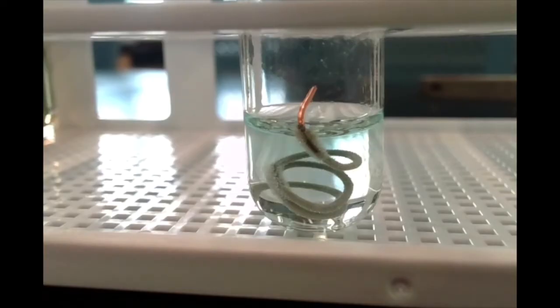And you can see the silver thickening as more and more of it forms from the silver ions in the silver nitrate solution. So the silver ions are turning into silver metal, and the copper metal is turning into copper ions. The nitrate stays nitrate, so that's what we call a spectator ion here. It's not really doing anything. But yeah, you can see basically our copper and silver nitrate are becoming silver and copper 2 nitrate.